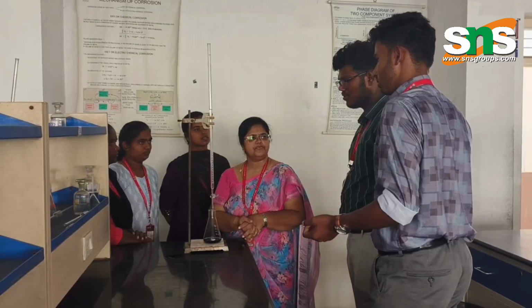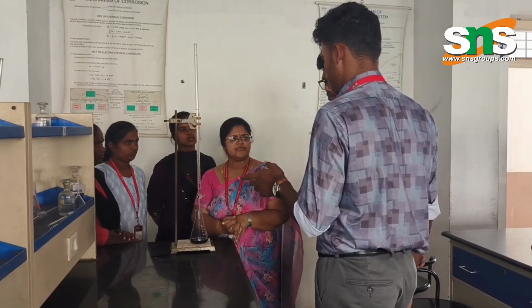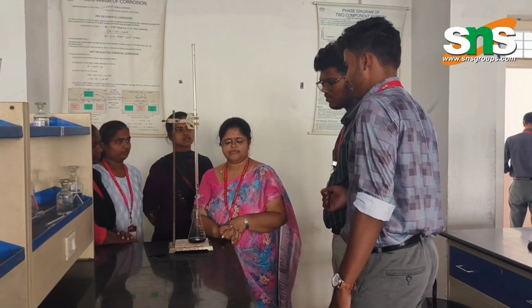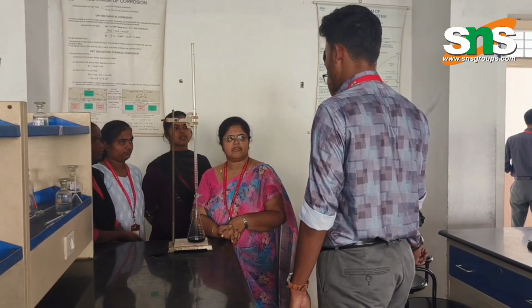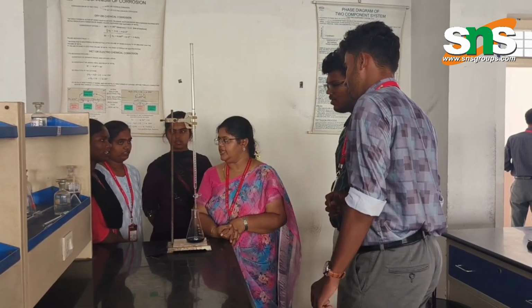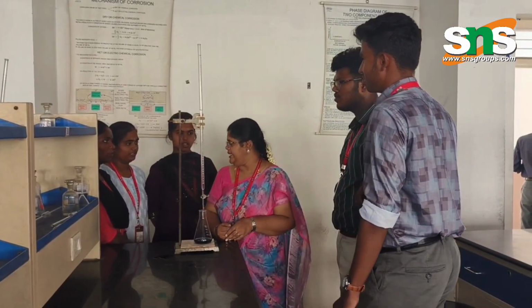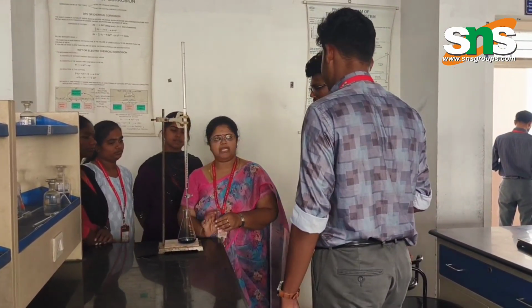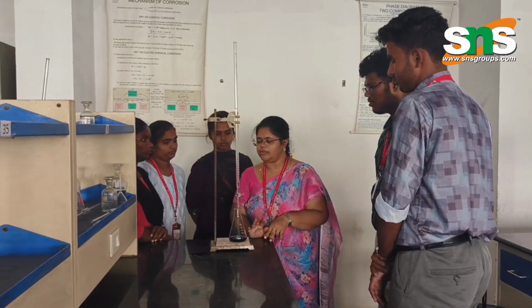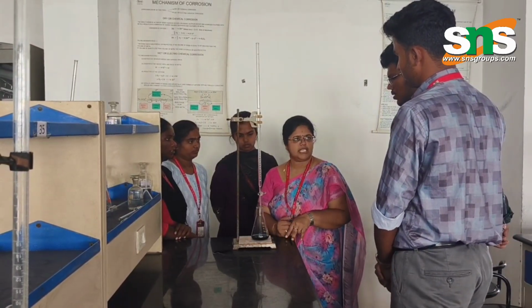Yeah, we pour the sample water, take 20 ml of it into a beaker, add 5 ml of buffer solution and the EBT indicator. Then you refill the EDTA solution. You add the EBT indicator and again you will get wine red color. So you repeat the same procedure and do the titration. Your end point will be steel blue in color.